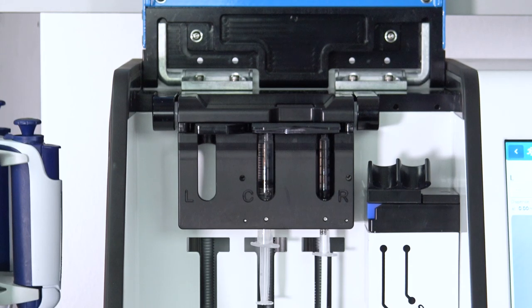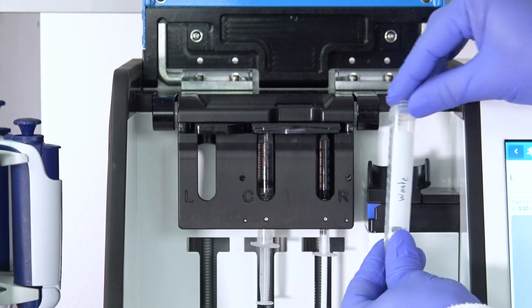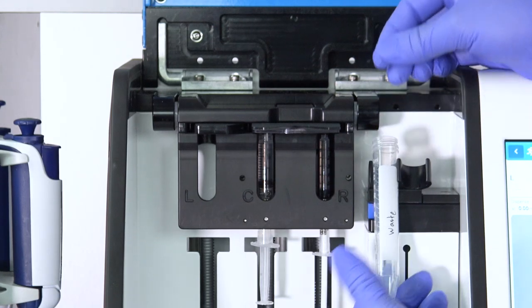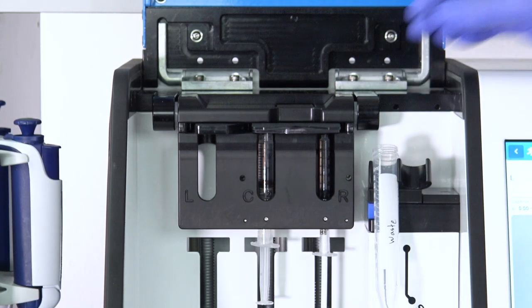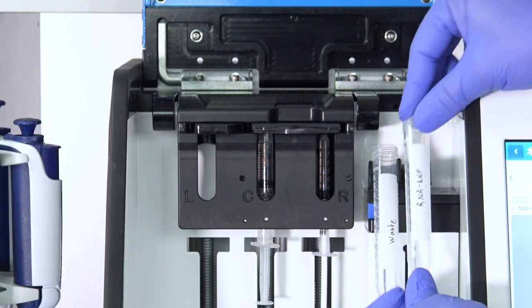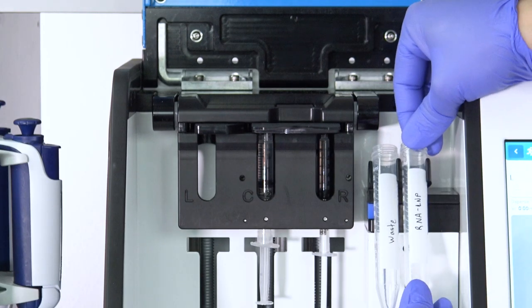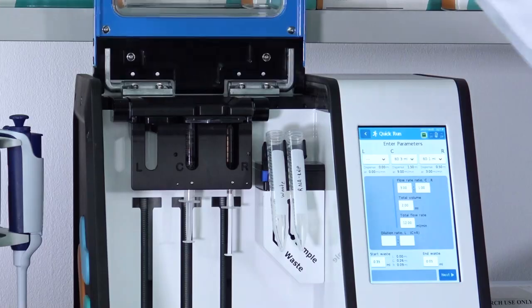Next, we'll add our collection tubes. So these are standard 15 mL falcon tubes. We'll start with the waste on the left. We'll snap that in and pull it down. And our sample collection tube on the right. Just like that. So we'll just close the lid.